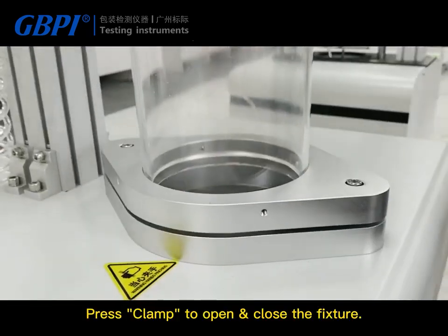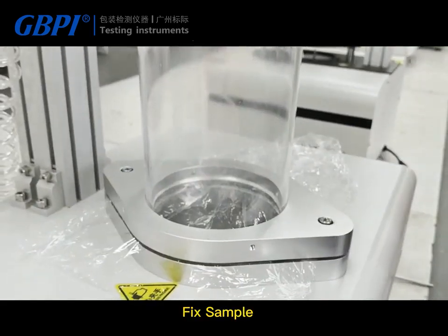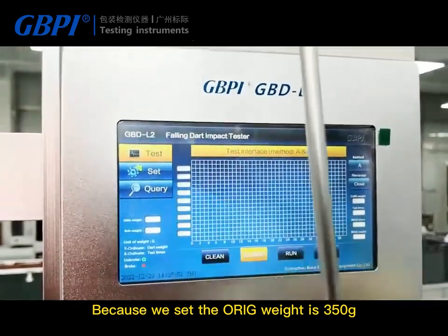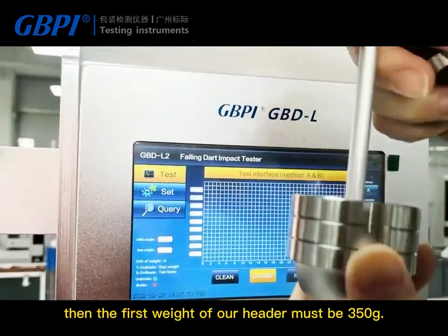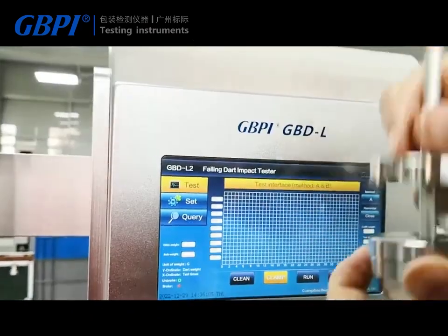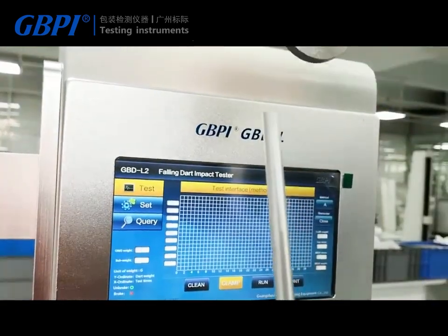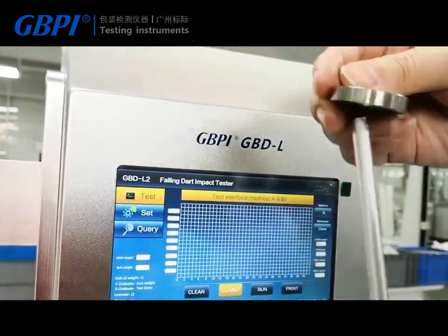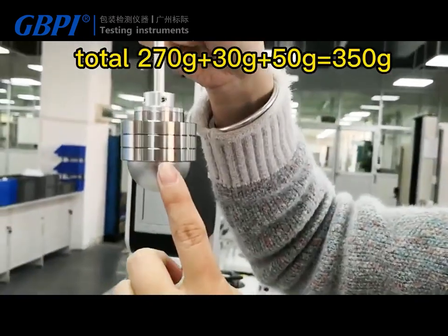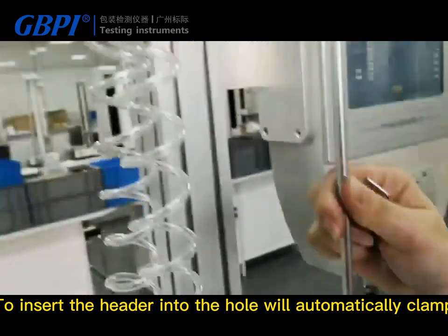Press clamp to open and close the fixture, then fix the sample. Because we set the original weight to 350 grams, load the corresponding weights. Lock them up, then insert the header into the hole — it will automatically clamp.